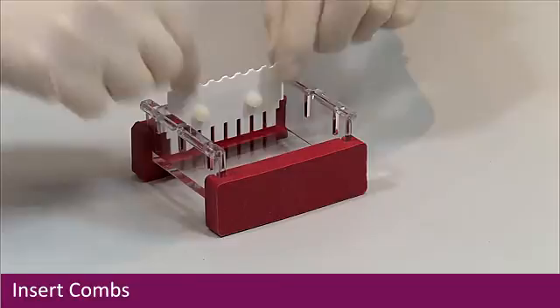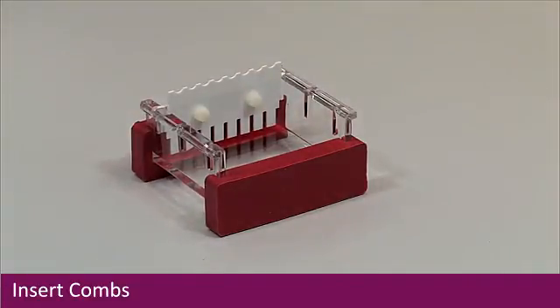Using the comb slots, insert the combs into the required positions in the tray.